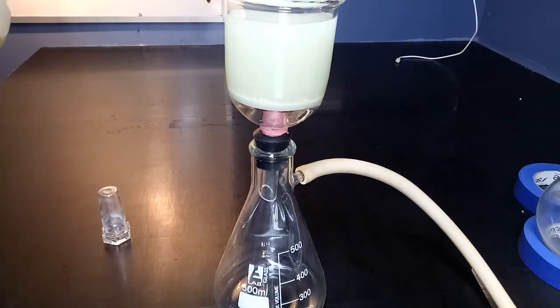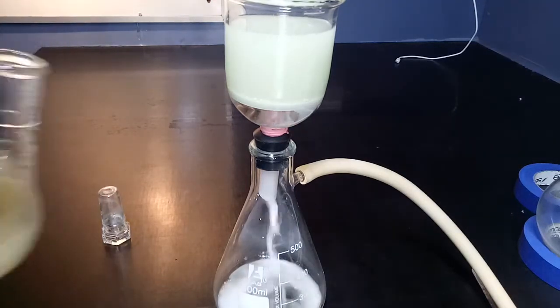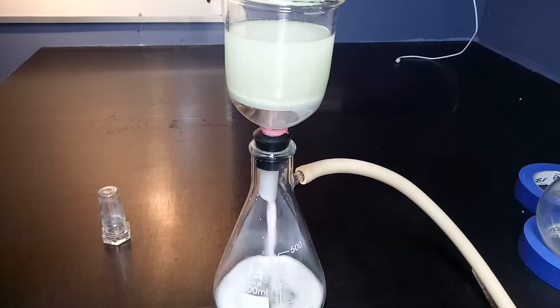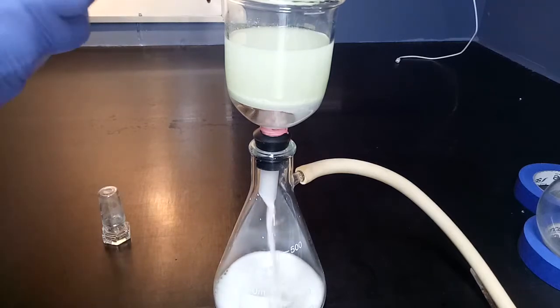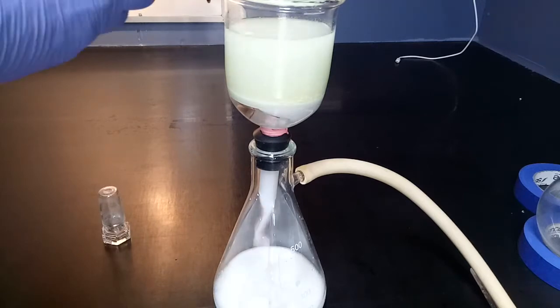We can see in this shot that we do have a lot of solid coming out. So this is unreacted oxidant. It should not have been there. It should have taken place in the reaction, and this one has contributed to the low yield.